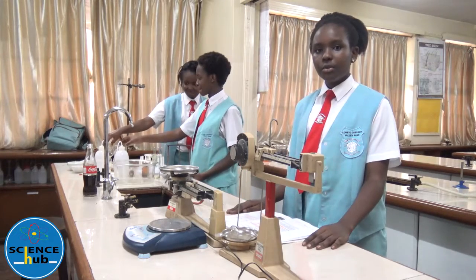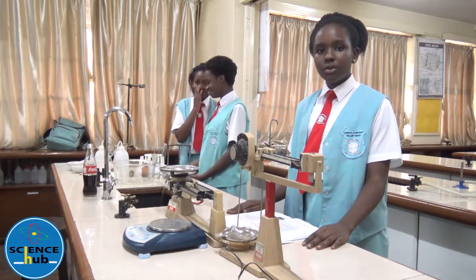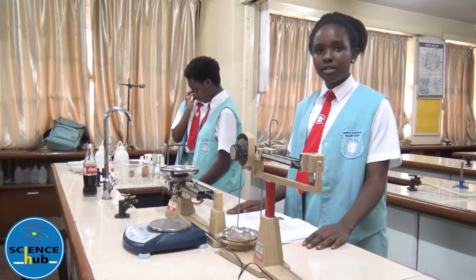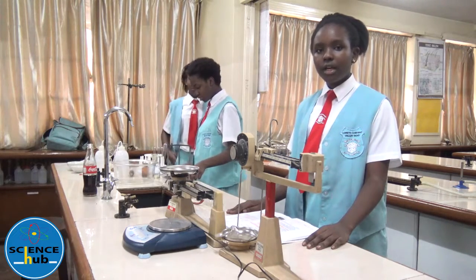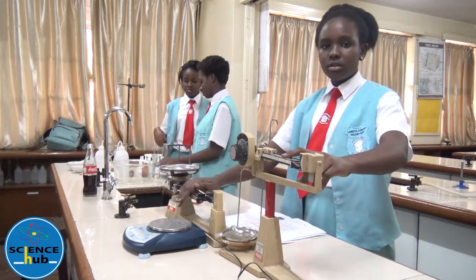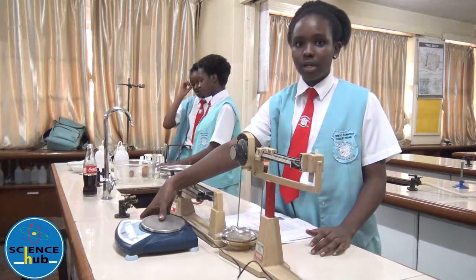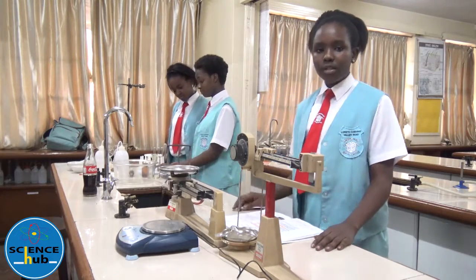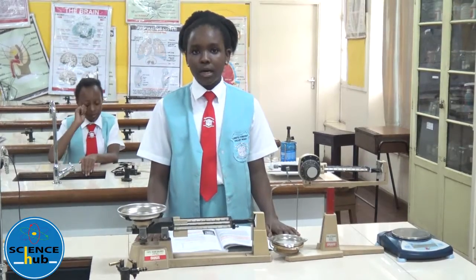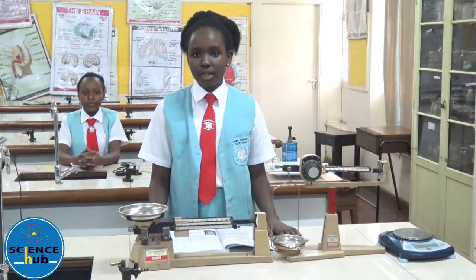I am going to take you to the apparatus used for measuring mass. Mass is measured using weighing balances. There are different types of weighing balances such as the beam balance and the electronic balance. This is the beam balance and this is the electronic balance. The electronic balance requires electricity.